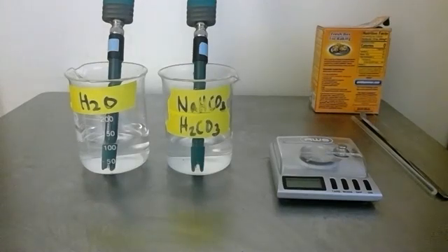In this video we are going to prepare a buffer solution and test it for how it reacts to an acid and a base being added. This video will focus on the addition of an acid and we are going to compare it to water which will not have a buffer system in it.